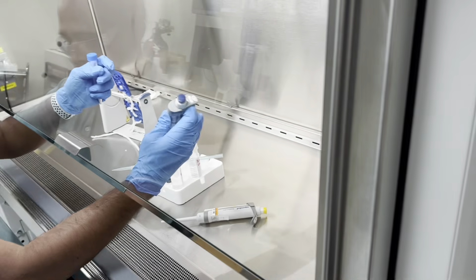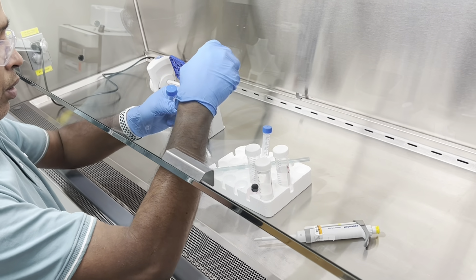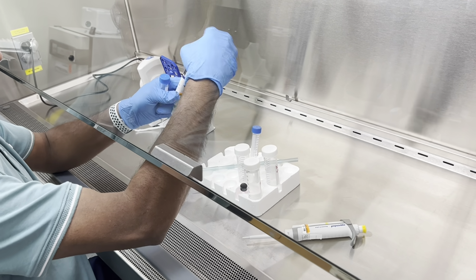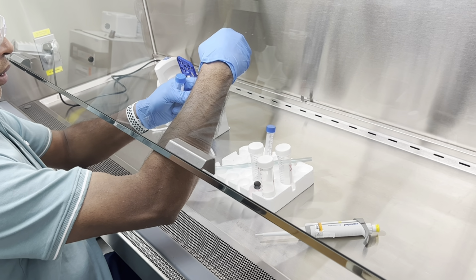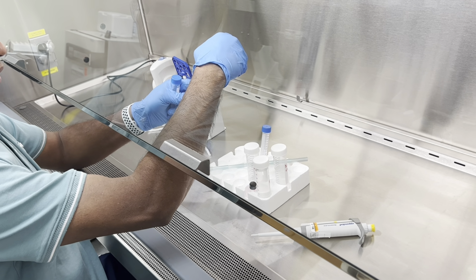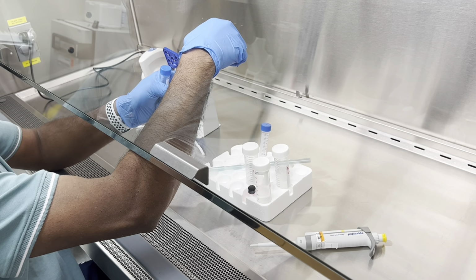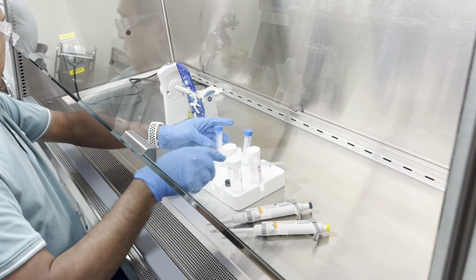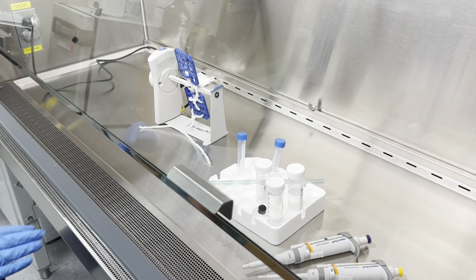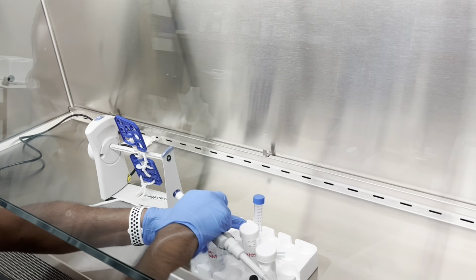So we'll take 175.52 microliters of the water into the two solids. Wait, by the way, we don't even have the protein here, right? There is no CRM, there is no BSA yet. So now we're using the water.